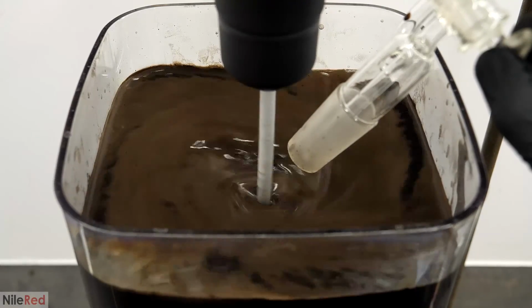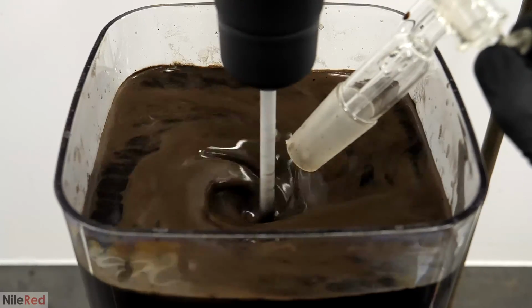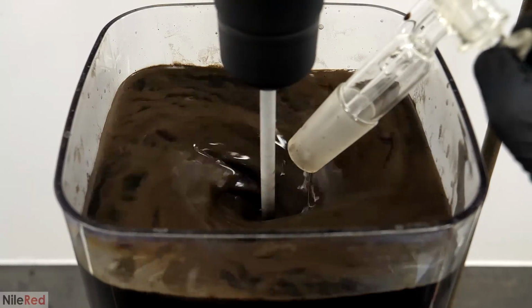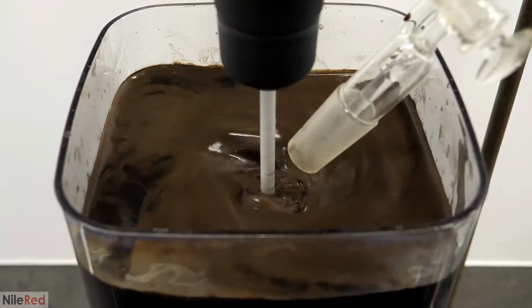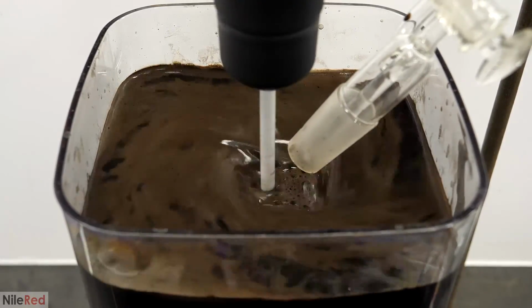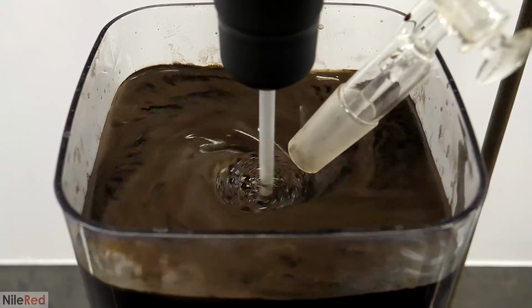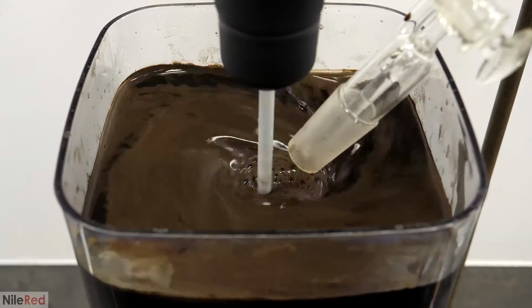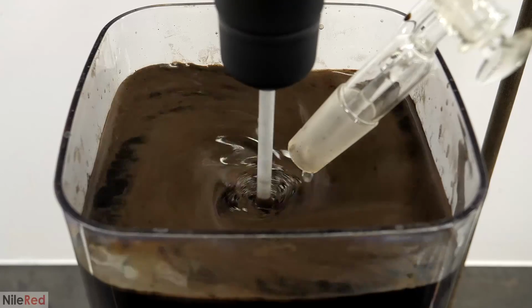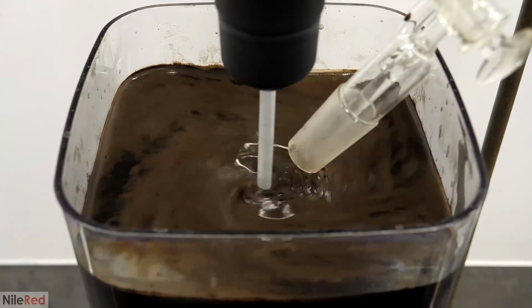Right now, this mixture was still very basic, with a lot of excess ammonia, and this was what the acid attacked first. This produced a bunch of ammonium chloride, and the pH slowly decreased. When most of the ammonia was eventually consumed, it then started attacking unreacted ammonium oleate soap, as well as the ammonium oleate that was on the surface of the magnetite. In both of these cases, it converted it back to being oily oleic acid, which was completely insoluble in water.